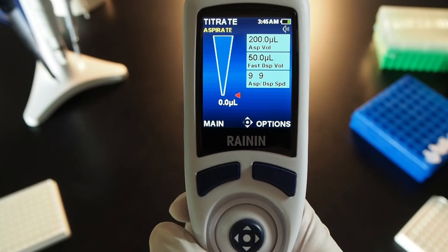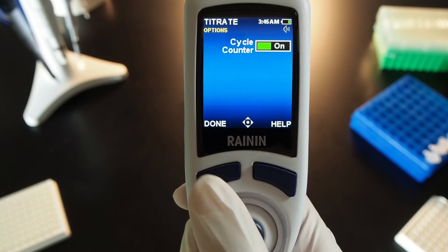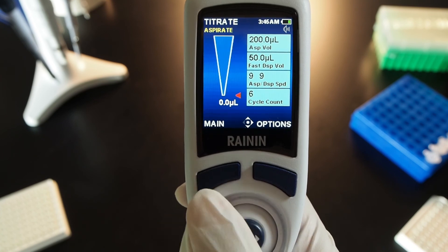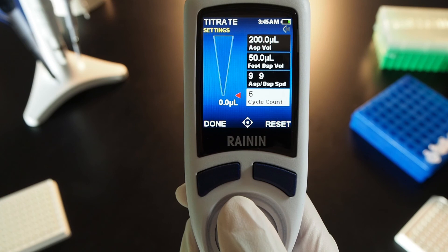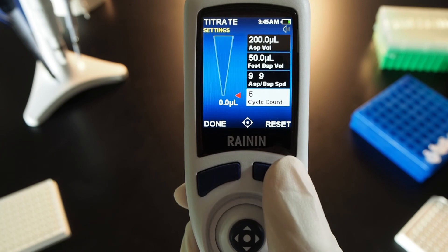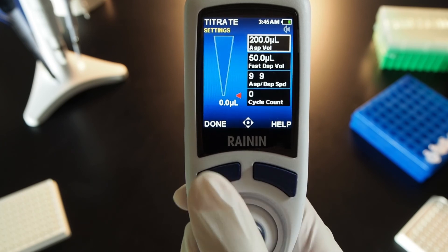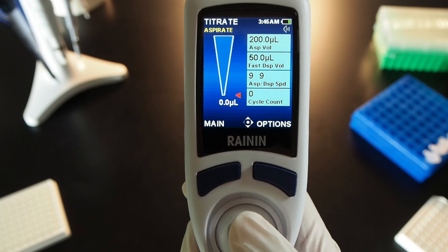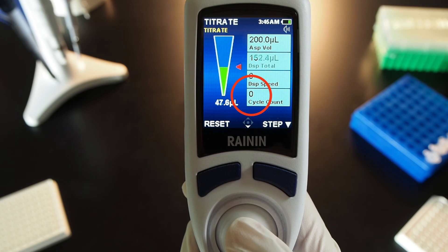To turn the cycle counter on or off, press options and press the joystick to turn the cycle counter on. Press done. Joystick right and navigate to the cycle count box. Press the joystick to select it. If there's already a value in the box, you can press reset to set it to zero, or use the joystick to change the number. Aspirate and dispense, and notice the cycle counter recording each cycle.